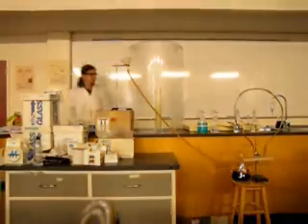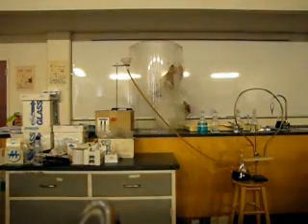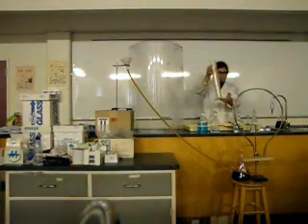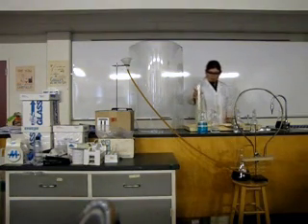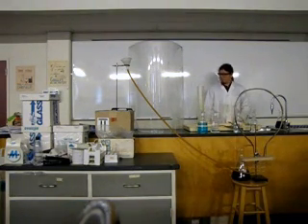And when I turn the lights back up, you'll see that it's coated with sulfur, which is why I asked if anyone had the sulfur allergy. Because that's coated with sulfur now. So that's the last one.